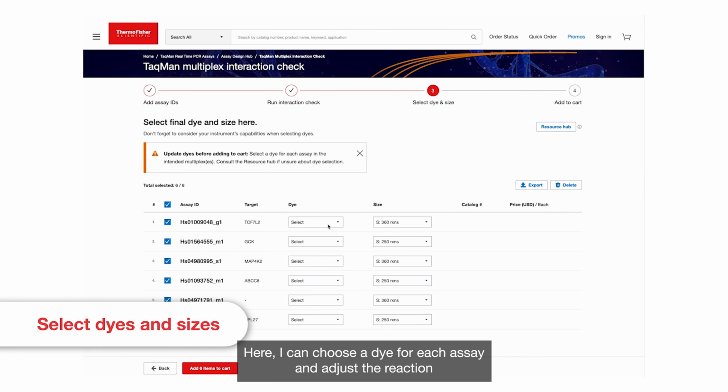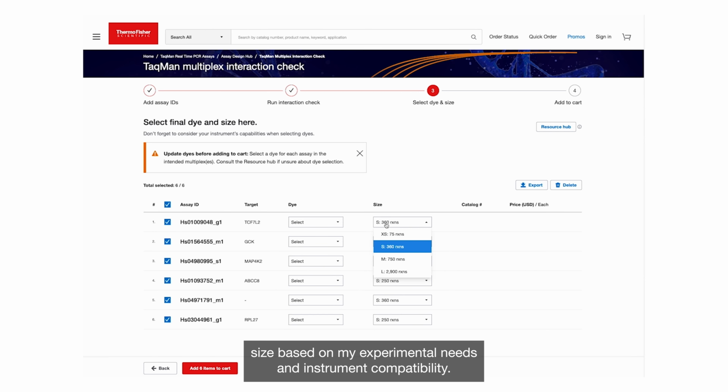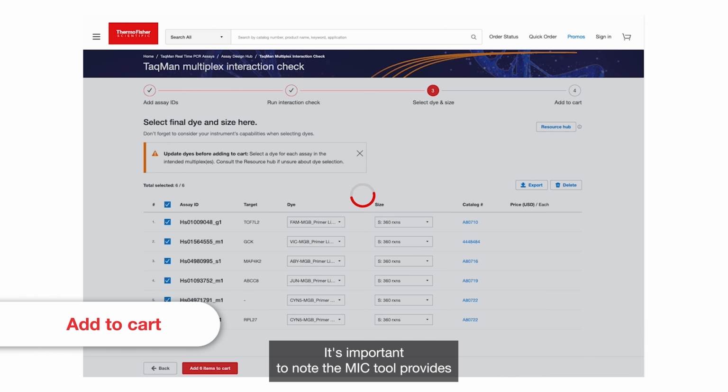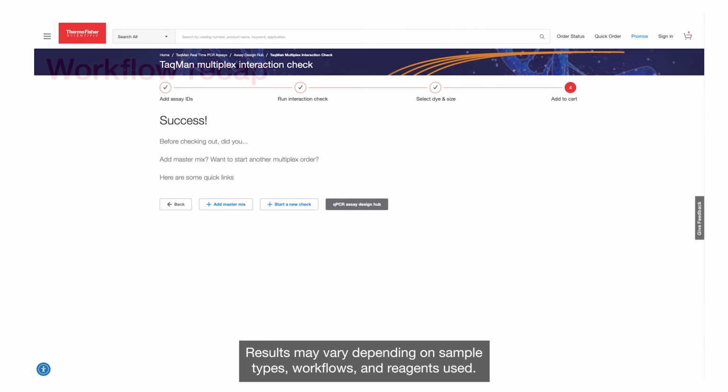Here, I can choose a dye for each assay and adjust the reaction size based on my experimental needs and instrument compatibility. If needed, I can refer to the Resources Hub for guidance on dye selection. Once everything is set, I simply add the assays to my cart to complete the process. It's important to note, the MIC tool provides predictions. Confirm results in the lab. Results may vary depending on sample types, workflows, and reagents used.